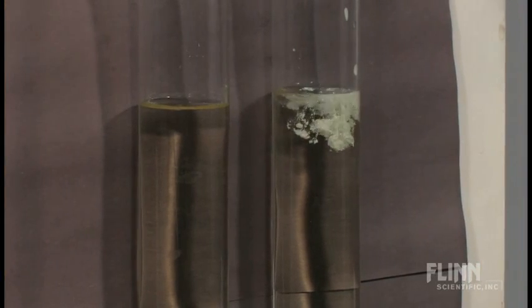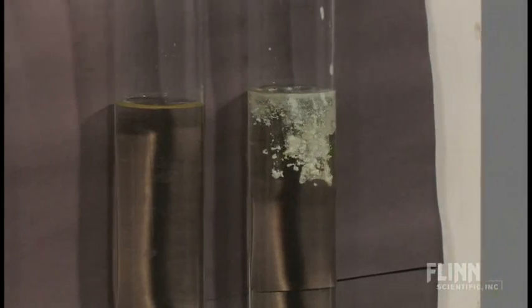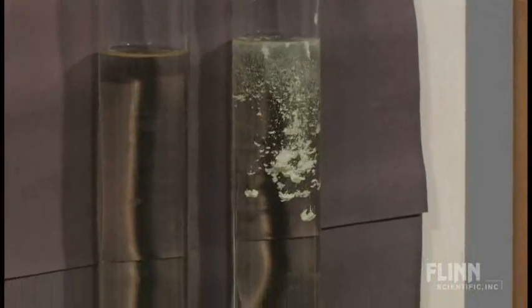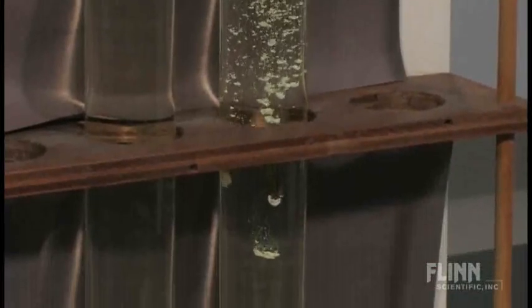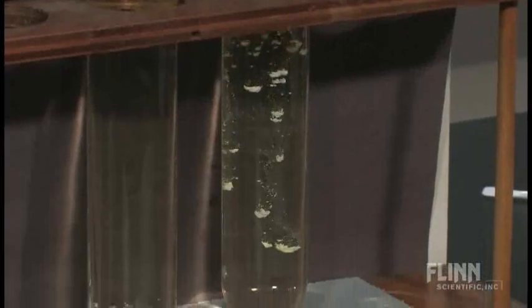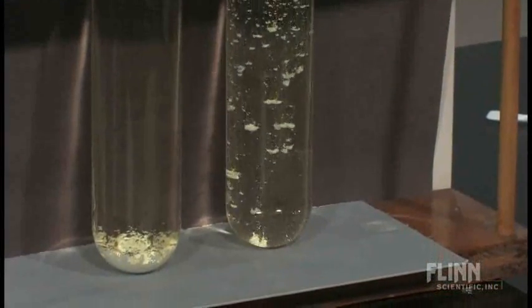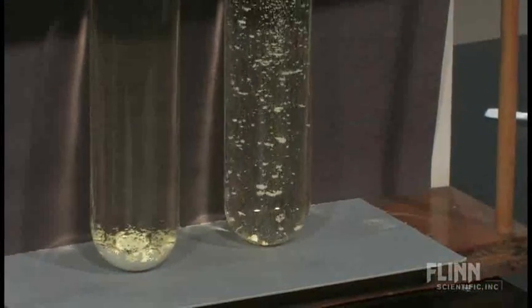And we see something interesting happening. That's what's called a precipitate. You can see it settling to the bottom. That's why they call it a precipitate. It's like it's raining in the test tube. In this case, little yellowish-white blobs appear to be settling down.